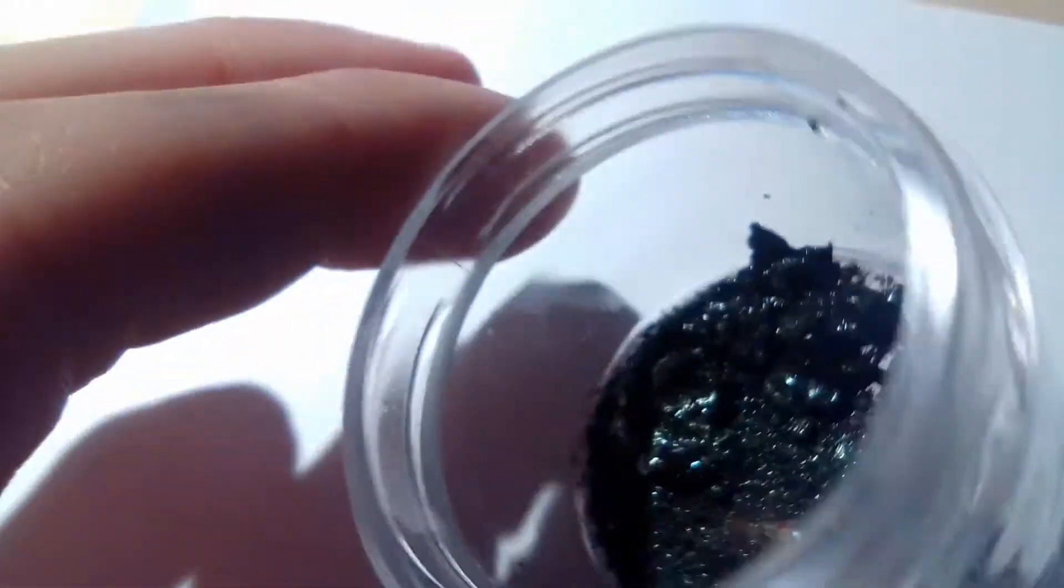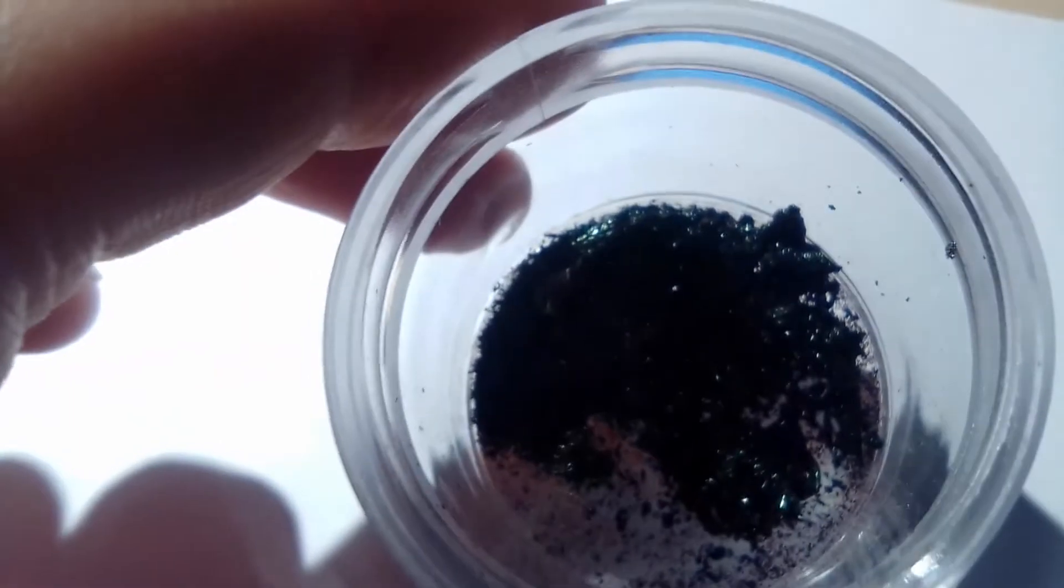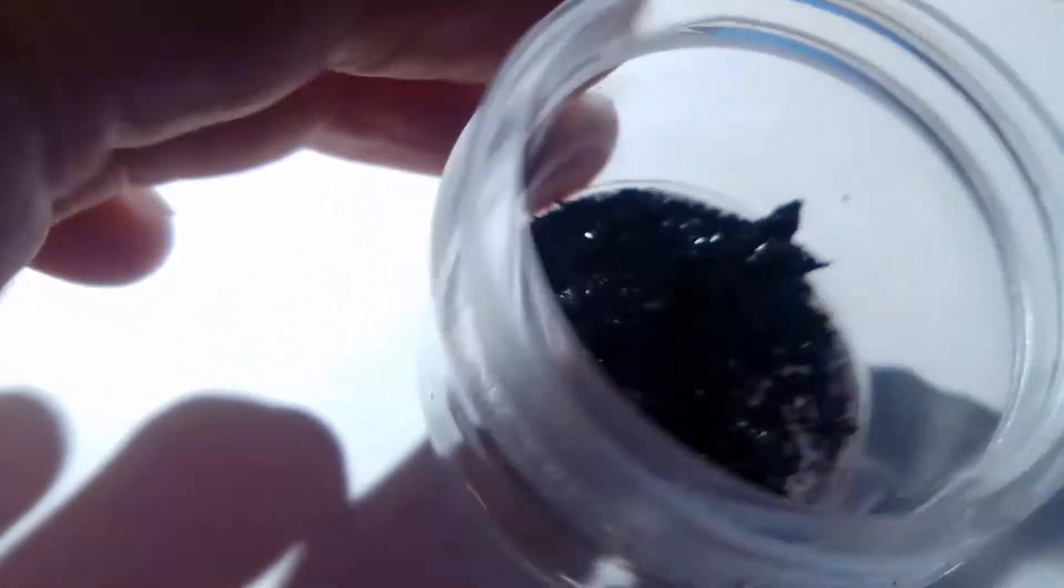But it is a nice dye and it is also a good pH indicator, and I am going to show you that in a minute.